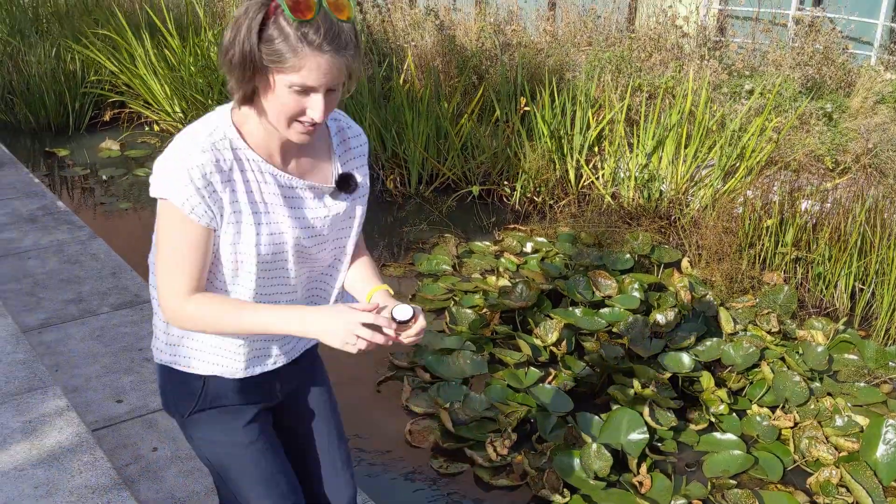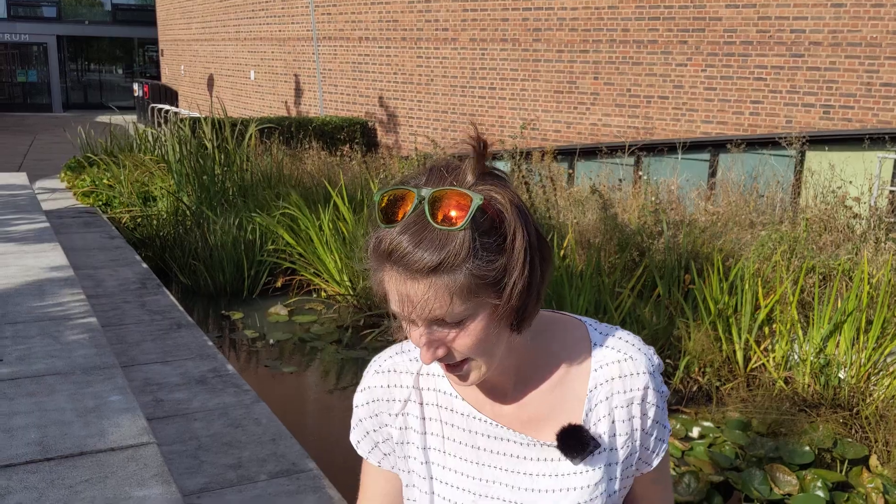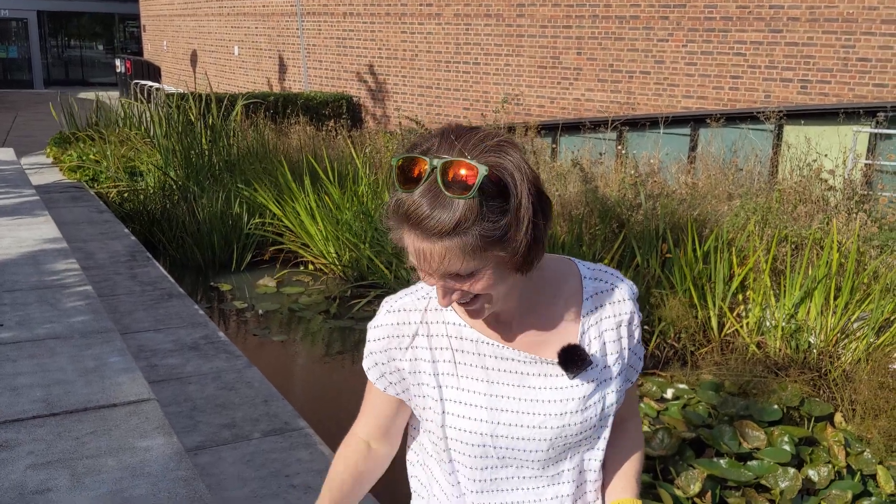Fill to the top, and it's really important to tightly squeeze on that lid — we don't want any leaks. The next really important thing to do once you've done that is to wash your hands, because as you'll hopefully find out there are millions of microbes in water sources all around us and some of them aren't too friendly.